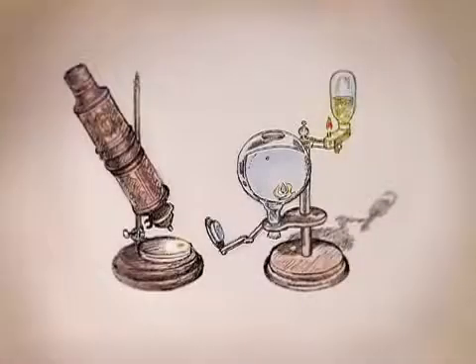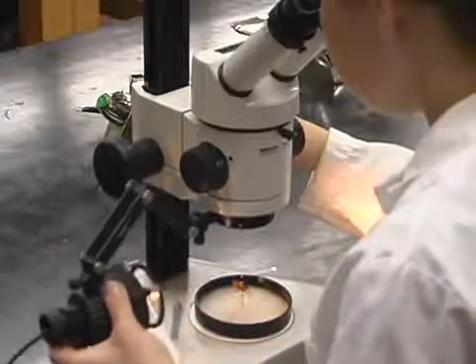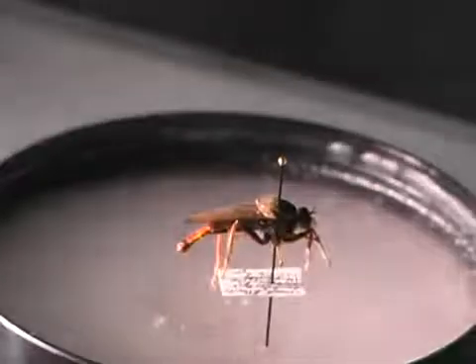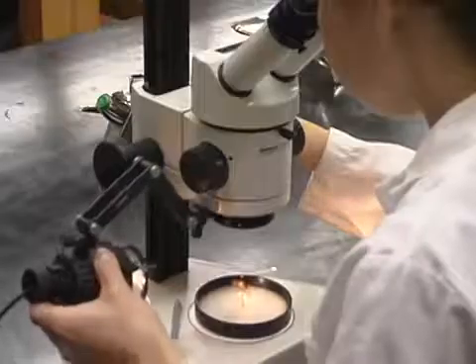When microscopes were first invented, sunlight or oil lamps were the only sources of light available to illuminate what people wanted to see. Various devices such as mirrors and lenses were used to direct the light where it was needed. Today, nearly all optical microscopes use incandescent lamps for illumination. The goal of lighting for microscope work is to obtain bright and even illumination across the entire field of view.